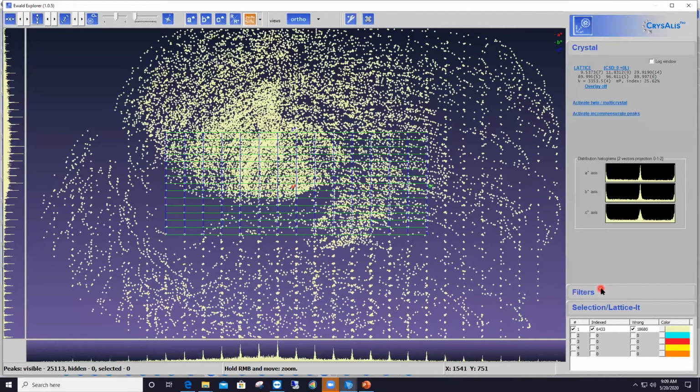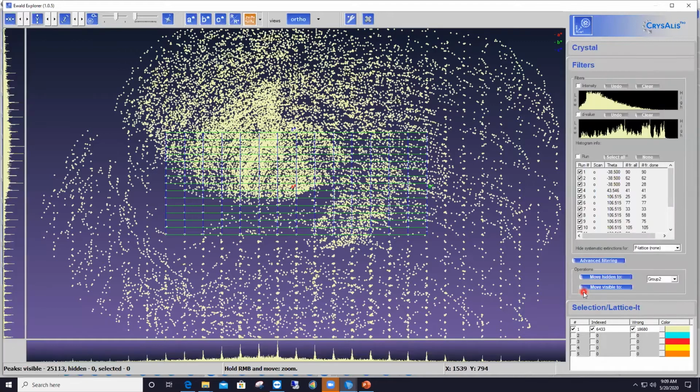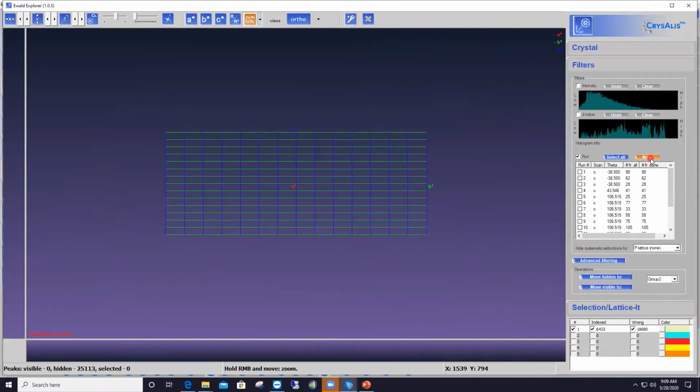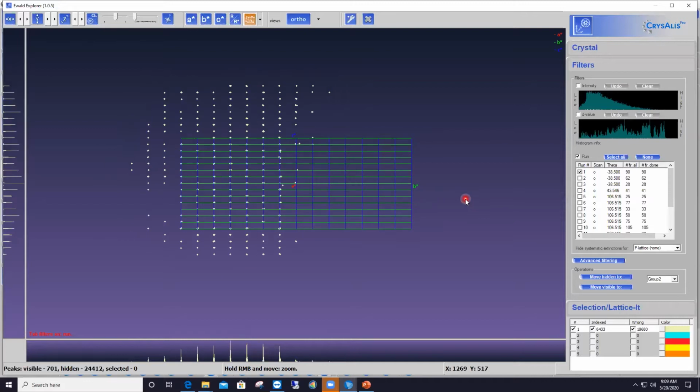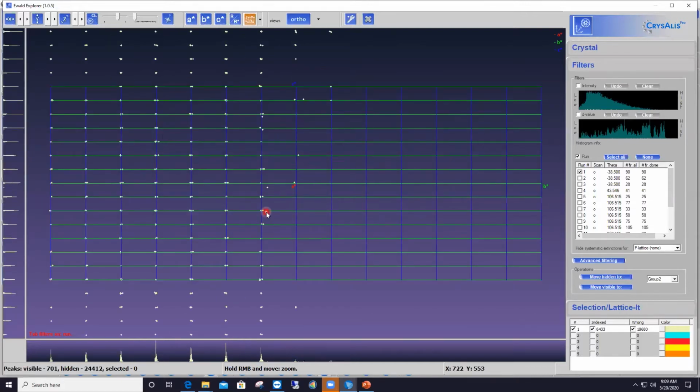There's a nice feature in CrysAlisPro that allows you to look at your dataset on a per scan basis. Expand the filters tab on the right-hand side panel, and then enable the run feature here. This is the feature that allows you to display the whole dataset scan by scan. Typically I would click on none to remove everything from the display, and then bring back scan number 1 only by checking that box. If I zoom in a little bit with my right mouse button, you see that all the reflections coincide with the lattice points, and everything is clean.